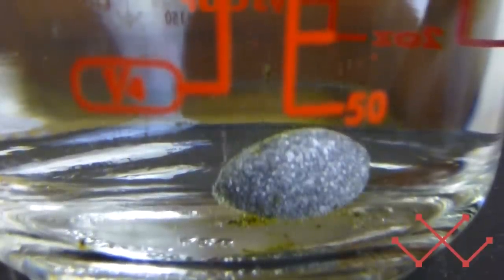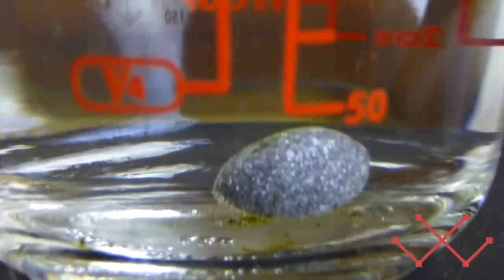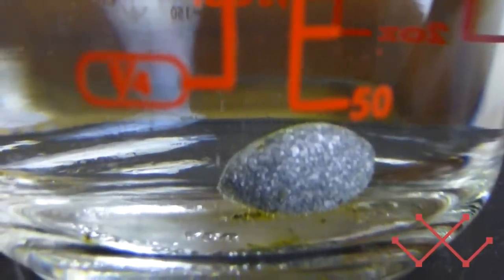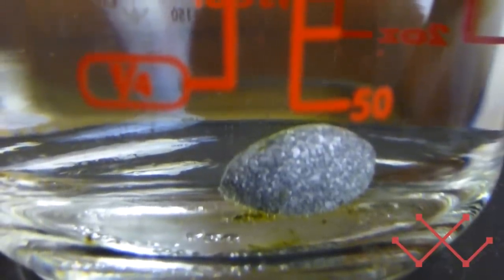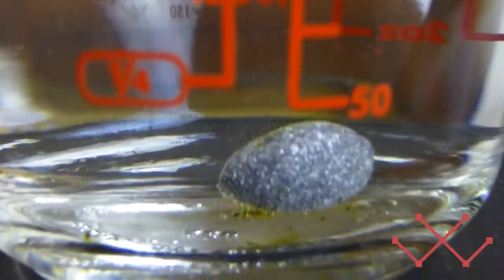As I zoom in on this metal vanadium, if it lets me zoom in on this metal vanadium, okay, I guess it doesn't, you can kind of sort of, there we go, you can kind of sort of see that it's bubbling quite a bit. Now, that is hydrogen gas, and it could be a little bit of oxygen gas, too. I'm not really sure.